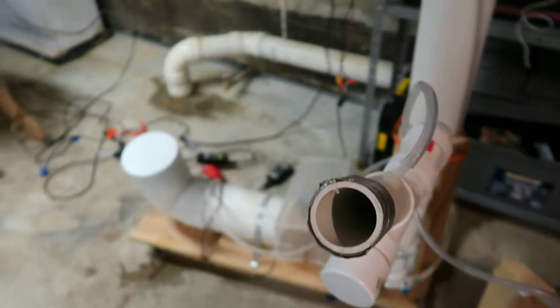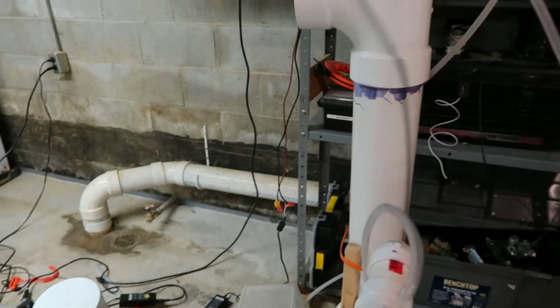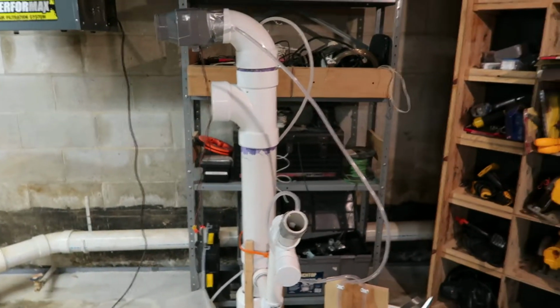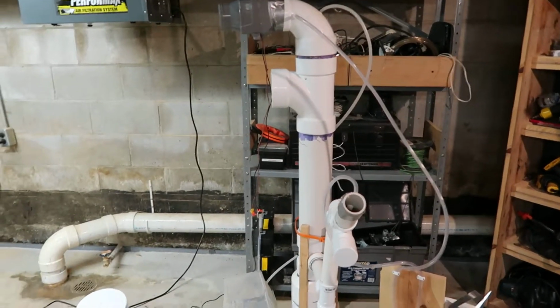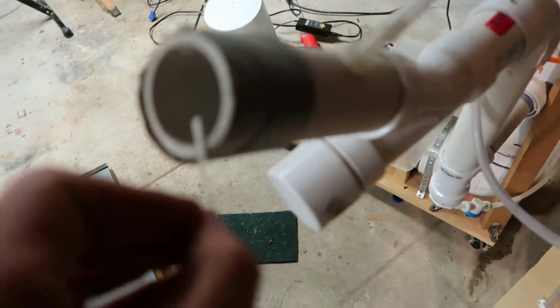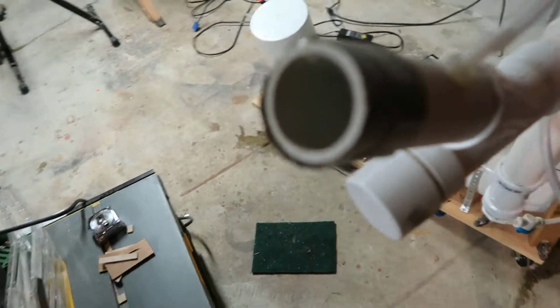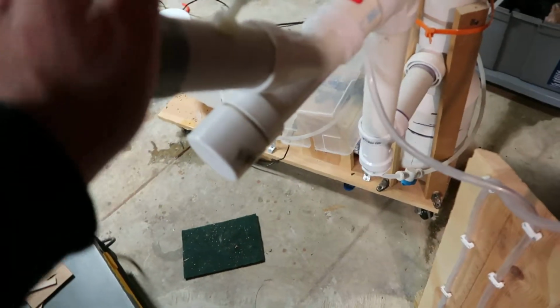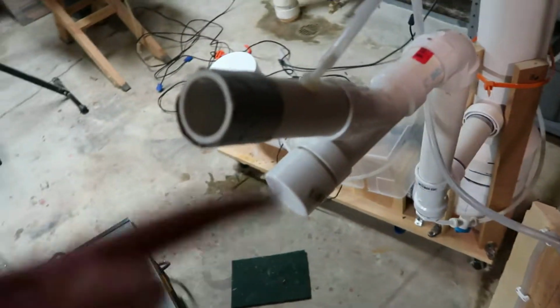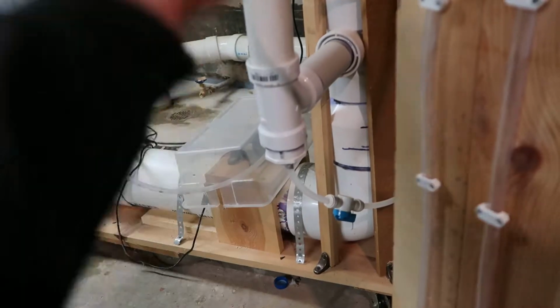And then over here, that's the draw, and yes, there is some draw. I'm looking around to see if I've got anything that I could put in front of it to show the draw. Maybe this, maybe not. Yeah, that doesn't work. Anyway, there's draw to it, and that's what's being drawn through the system. Right now this is open all the way, so it's blasting water through here.